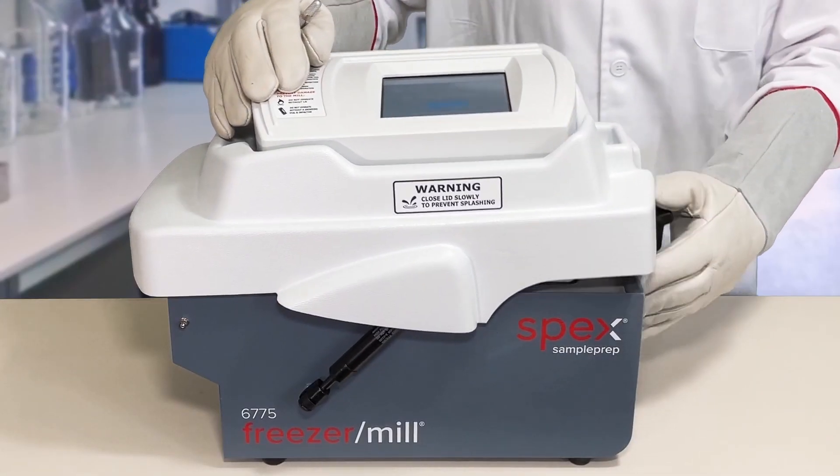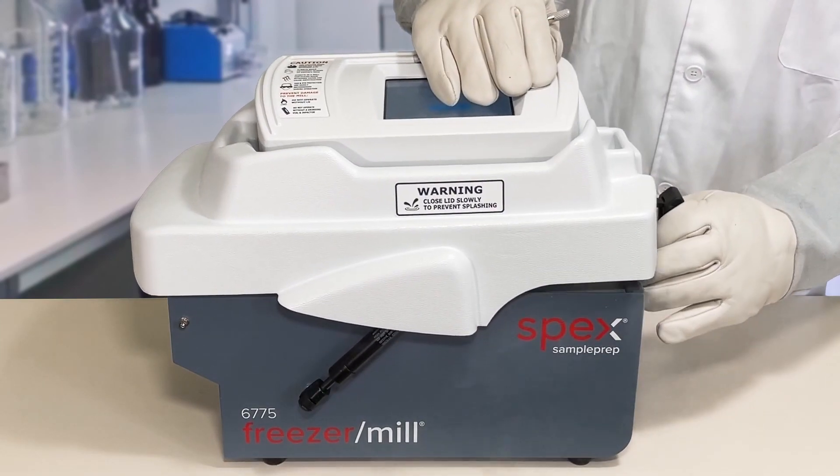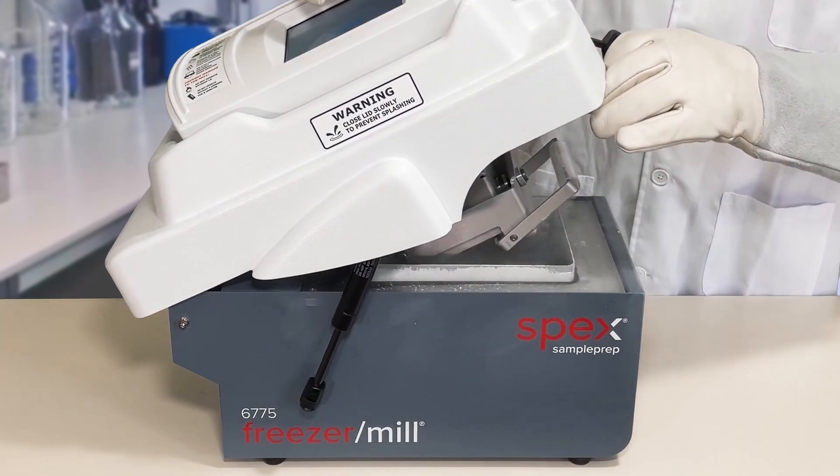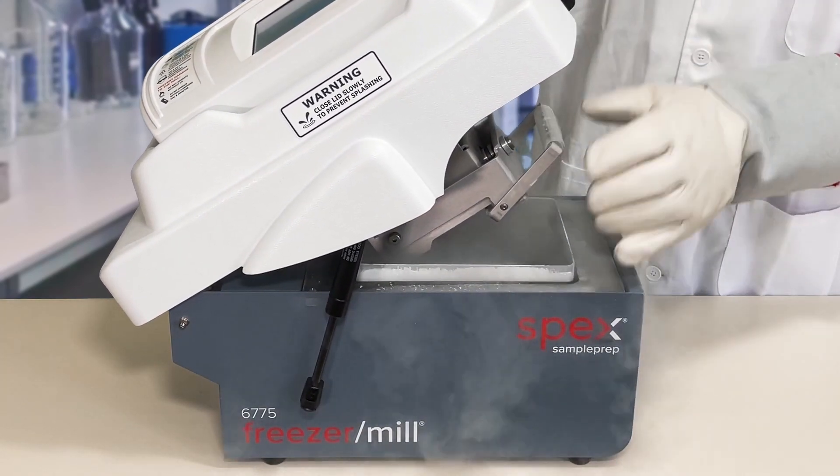It's time to take it out. Wear safety gear and use a magnetic pin to extract the milling vial from the chamber.